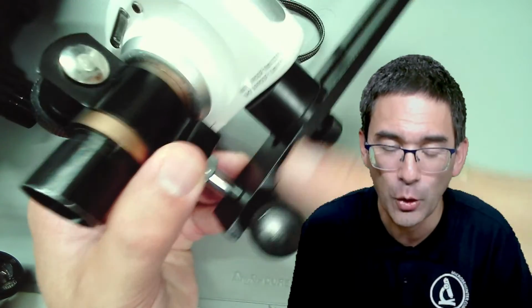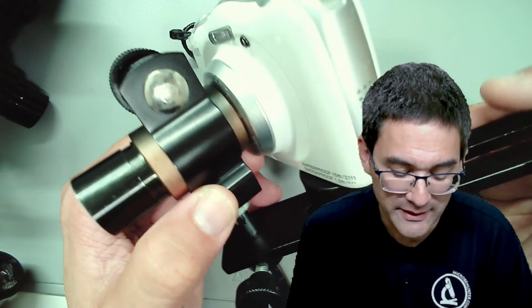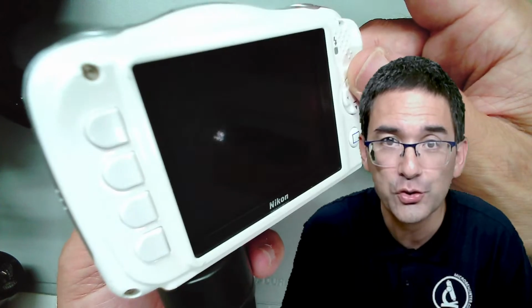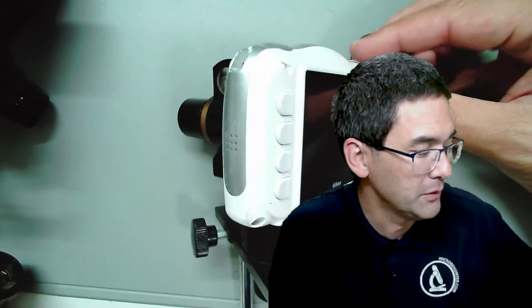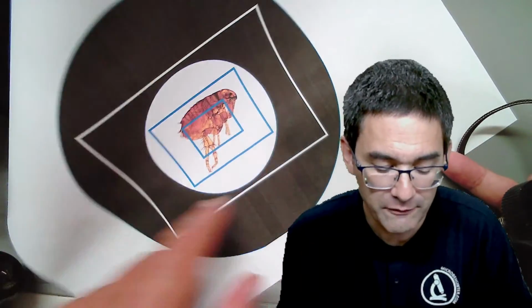It doesn't quite look as compact and as nice. What is the advantage and the disadvantage here? Well, the advantage is that because you have an optical zoom, you're able to zoom in so that you are able to see the image here again. Like this. You're able to zoom in optically so that you don't have the circle here.